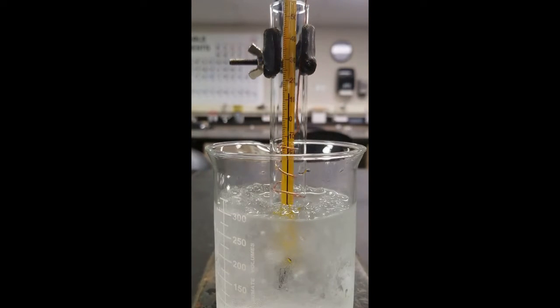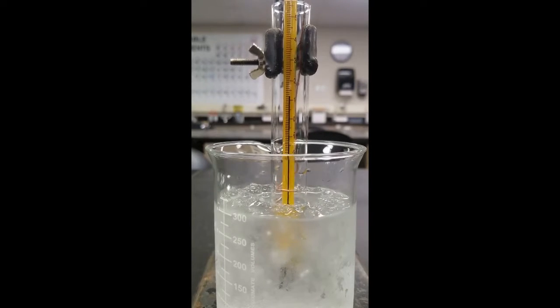And then what you want to do is basically just record the temperature every about 15 to 30 seconds. Note that this 1 is 10 and then the 2 is 20. See, something like that. It's probably a good angle right there while I stir.